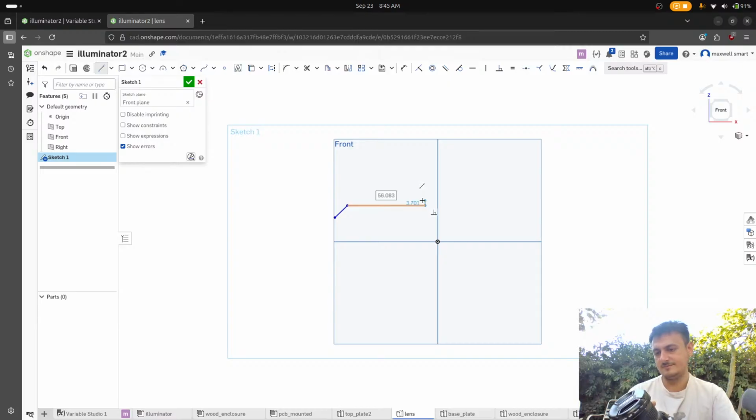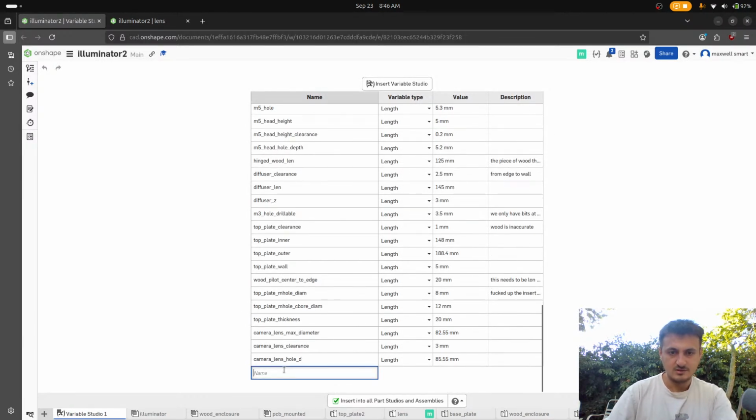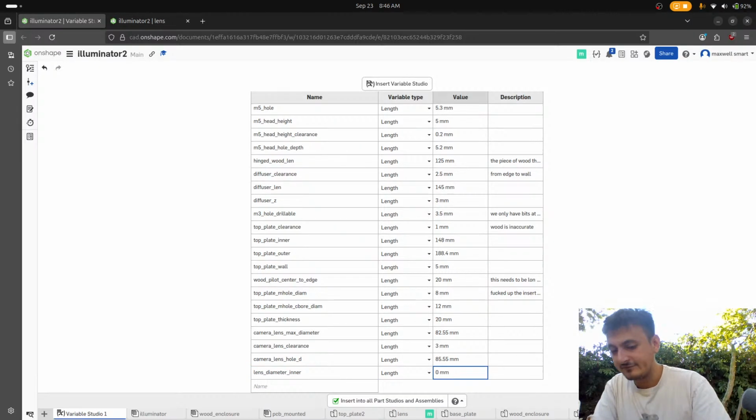Okay, so wait, let's get some measurements down. So the base general is gonna be 70. All right, so the lens inner camera hole lens diameter, camera lens diameter, like inner, like not with the attachment. I don't know, terrible name, but what was it? 70.